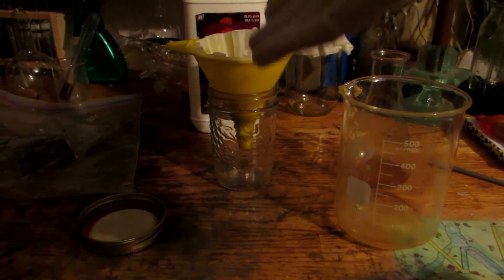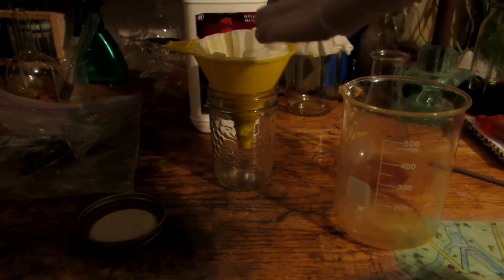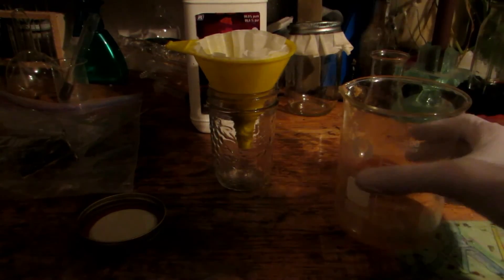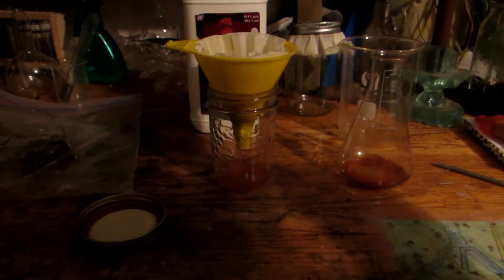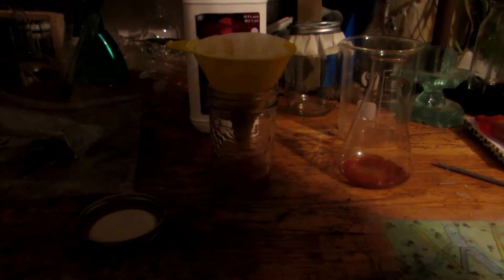Okay, so I simply transferred the filter paper and our ammonium chloride to a separate jar which we will be storing this methanol in. I've just added a bit to the beaker to wash out any of the remaining stuff. So swirl that around and pour it all in. This is going to start removing all of that horrible color, but hopefully all of our ammonium chloride, or at least most of it, will stay in the filter and be nice and clear. We'll do a couple washings with methanol and just save the methanol. We can always redistill this off if you have a distillation apparatus to reclaim the methanol as you don't want to spend copious amounts of money on more methanol.